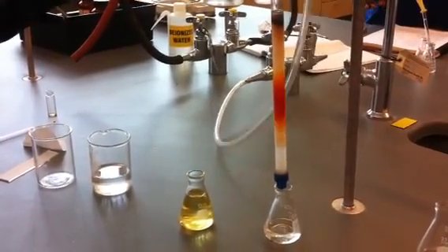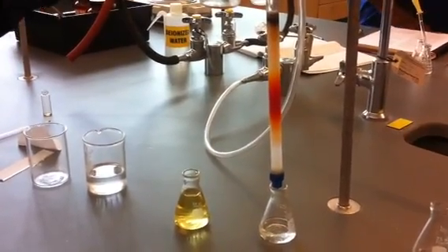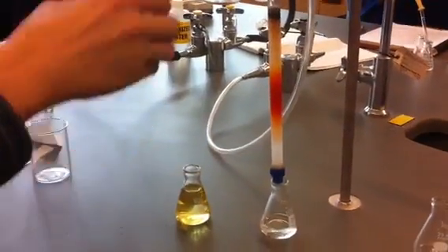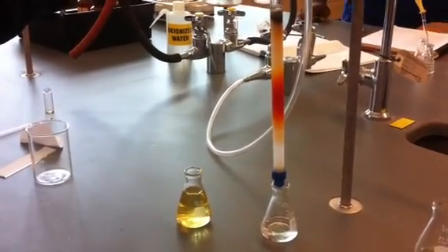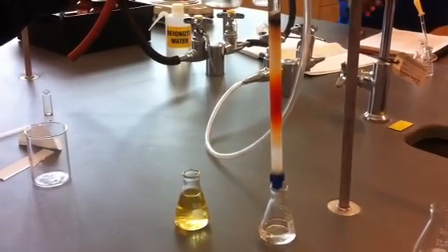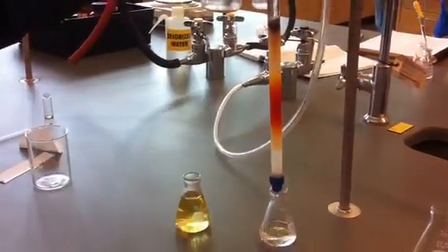Oh, except I forgot that it would crack a little bit. Okay, that's not so good. They're both here, but I'm going to get that. You don't want to have it crack like that. That's because I let the pressure off too fast. Here, you need to stretch it out. And this is so much more polar. It's probably heated up the column.